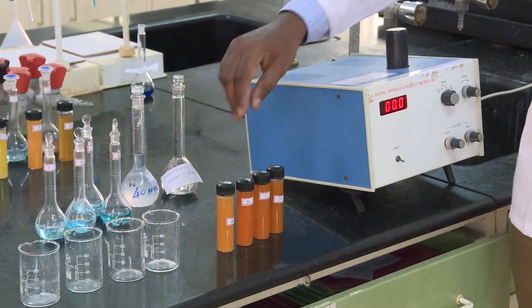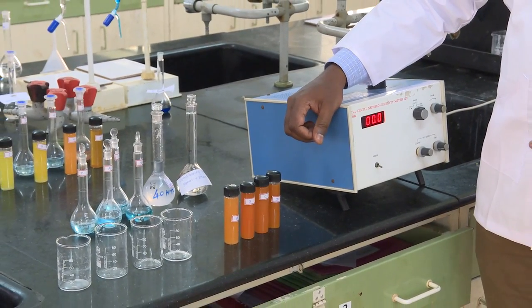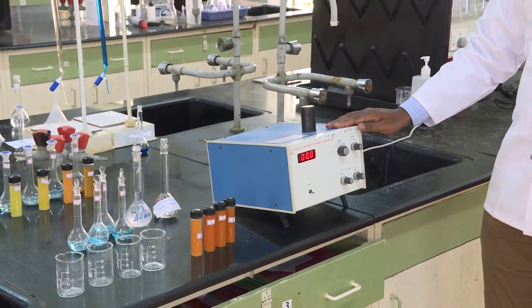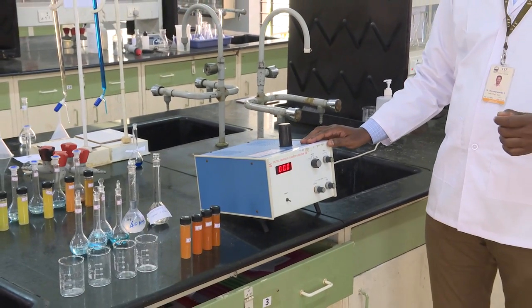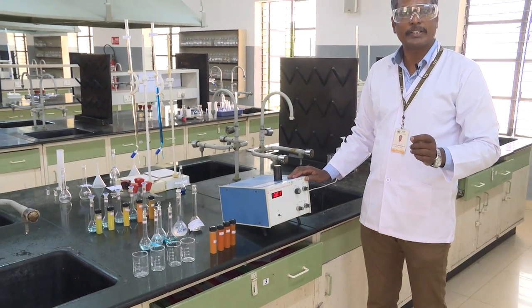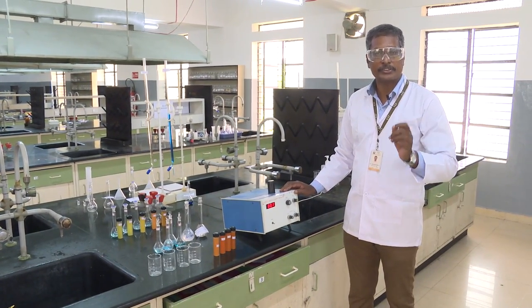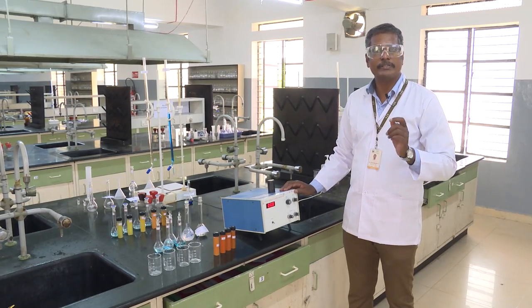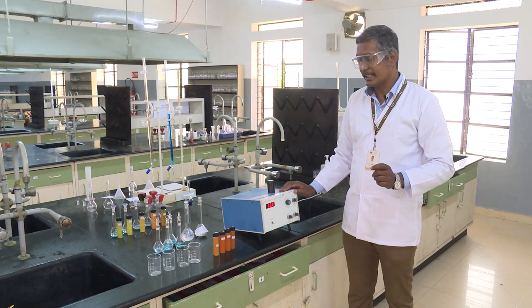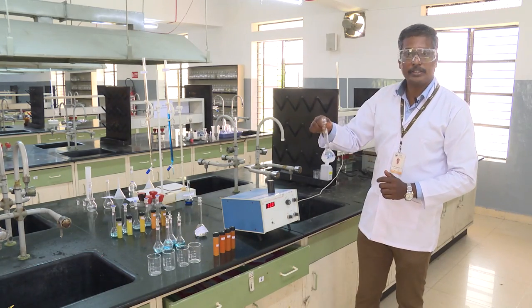Once we complete the second part of the experiment, we have seen the reddish color of the copper oxide nanoparticles. Our next task is to measure the turbidity of the samples. The turbidometer principle: turbidity is related to the size of the particle and also determines concentration — higher concentration of suspension gives higher turbidity, and larger particles give very high turbidity. Before using this instrument we need to calibrate it using a standard turbidity solution of 40 NTU.